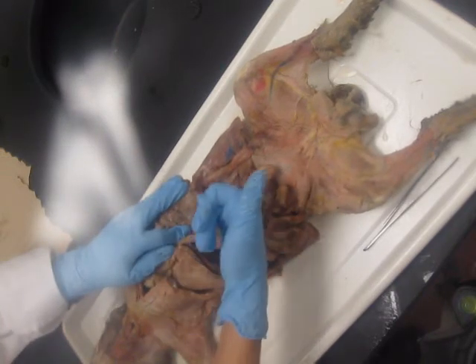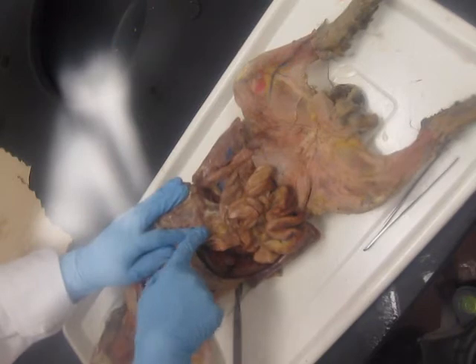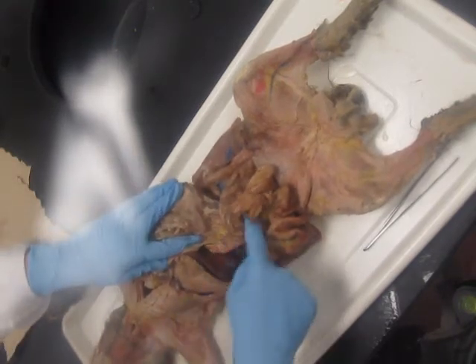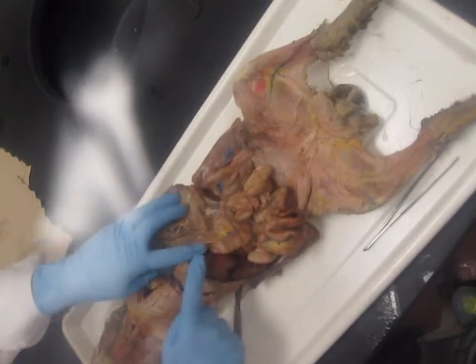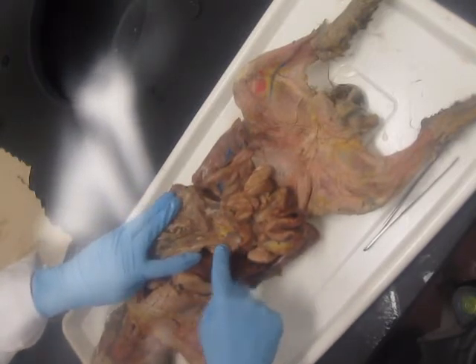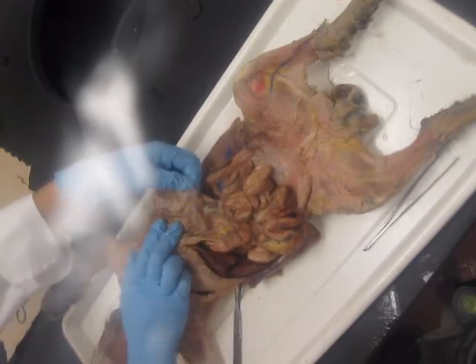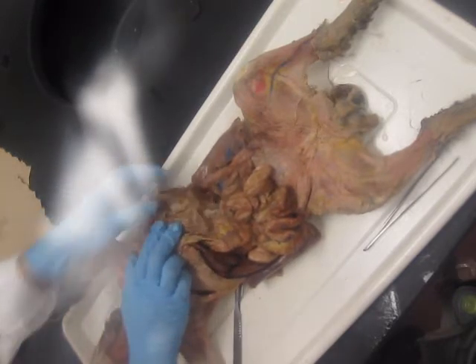And this glandular material looks like cooked ground beef. It's nodular and it's brown. And you got your pancreas. And you got the head of the pancreas along the duodenum, the body of the pancreas under the stomach, and the tail of the pancreas next to the spleen.